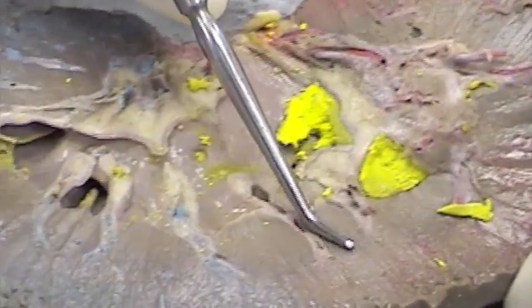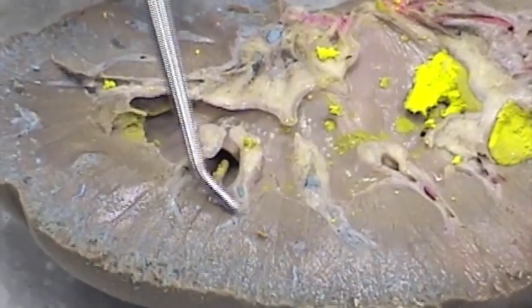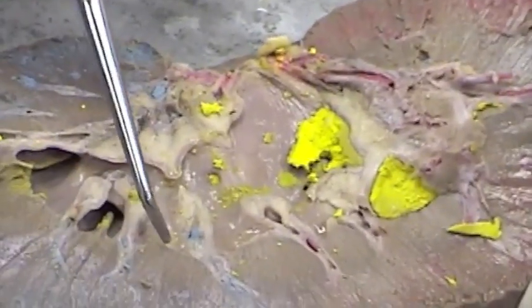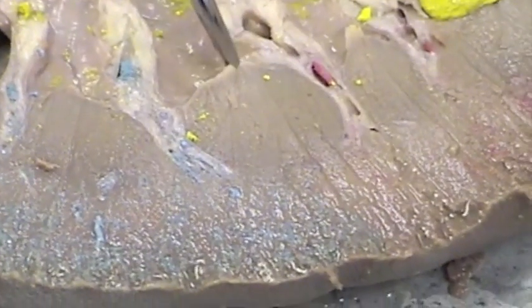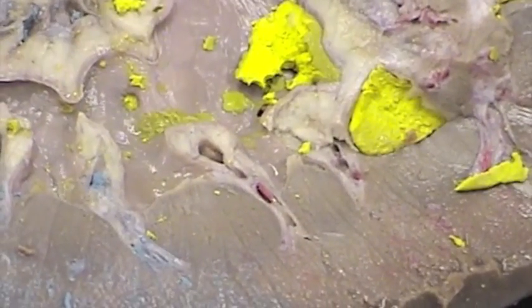Between the cortex and the inner space is what we call the medulla. The medulla of the kidney is made up of renal pyramids. Here's one that's pretty easy to see — I'll outline it right here. Here is a renal pyramid, here's another renal pyramid. Here's the apex of the pyramid, here's the base of it. The medulla is made up of a bunch of renal pyramids.